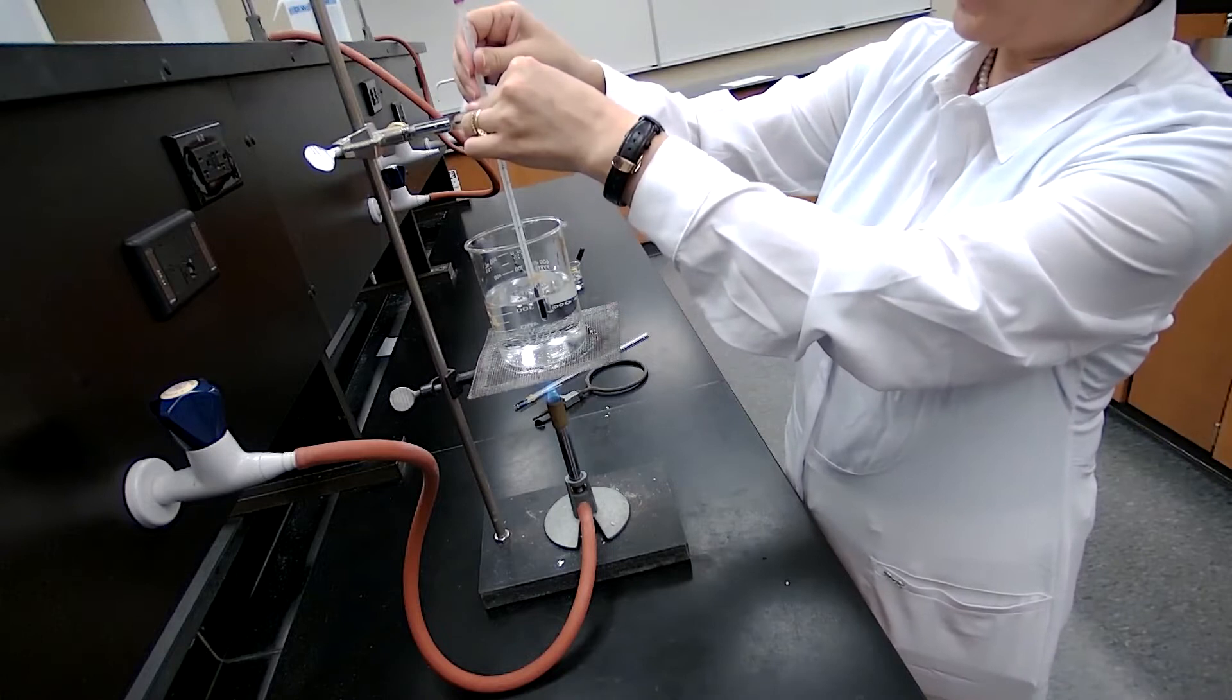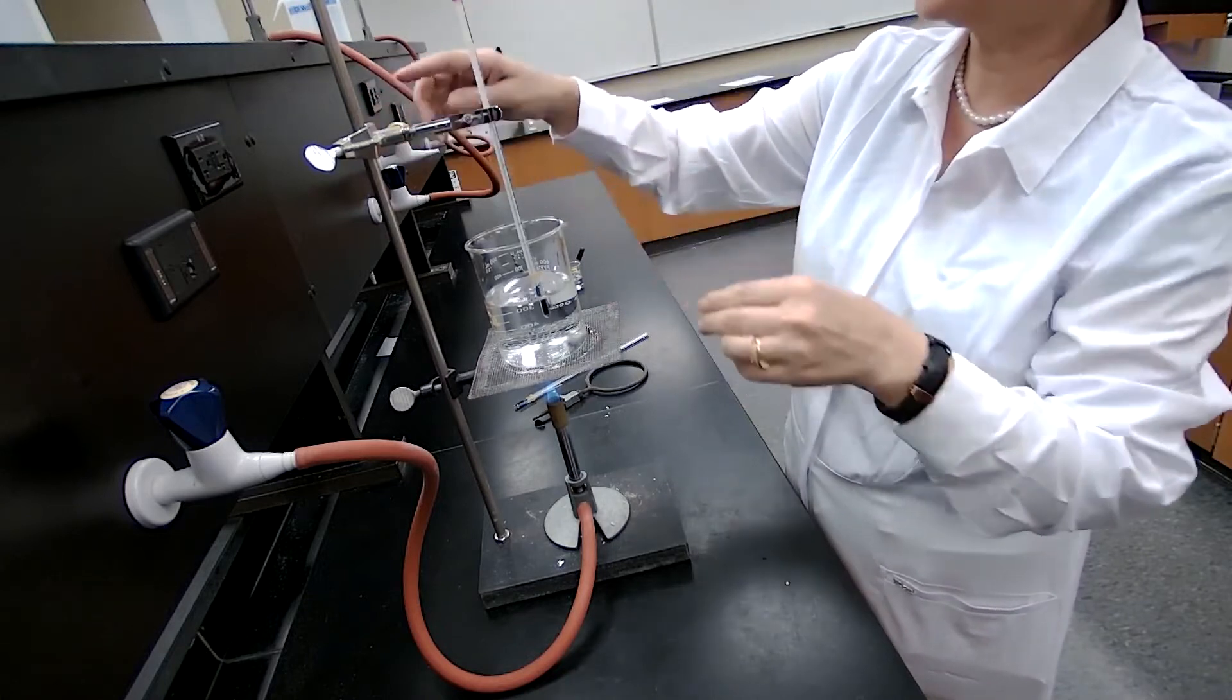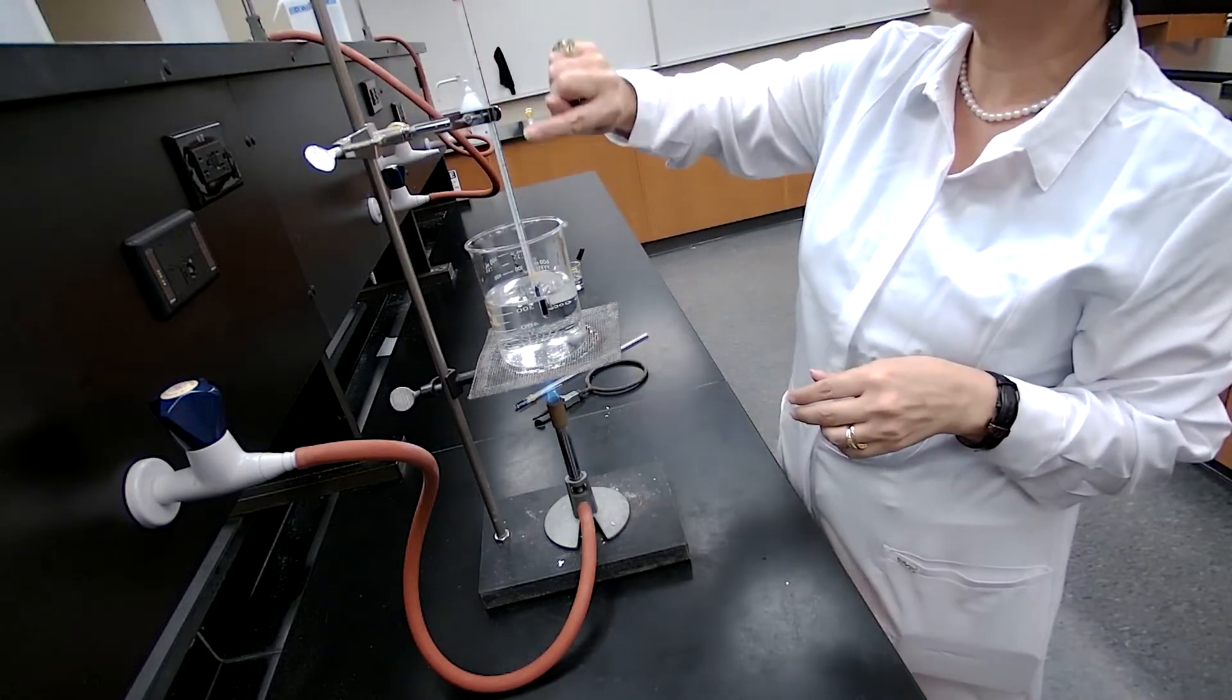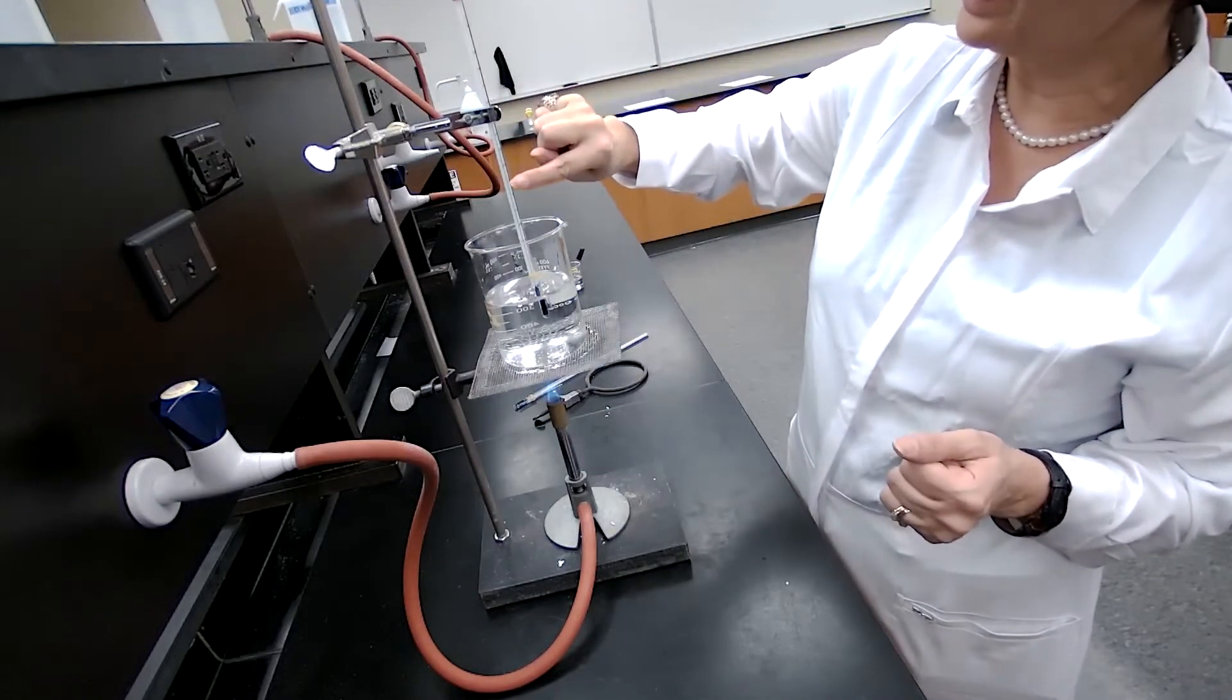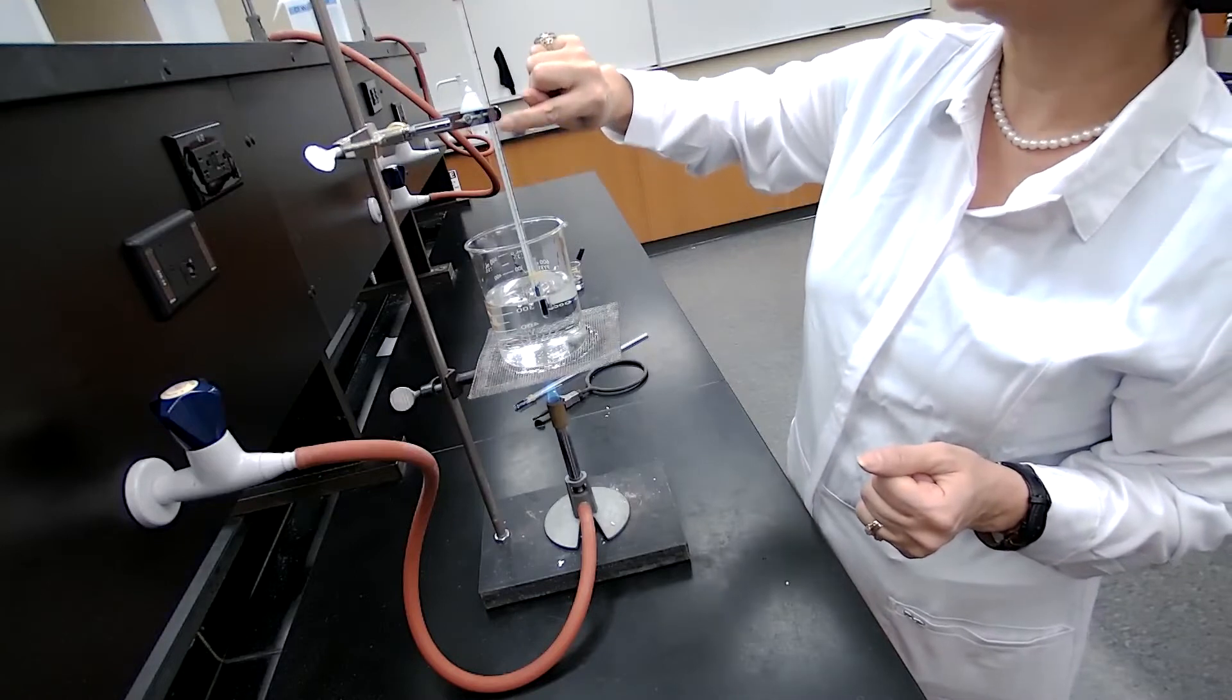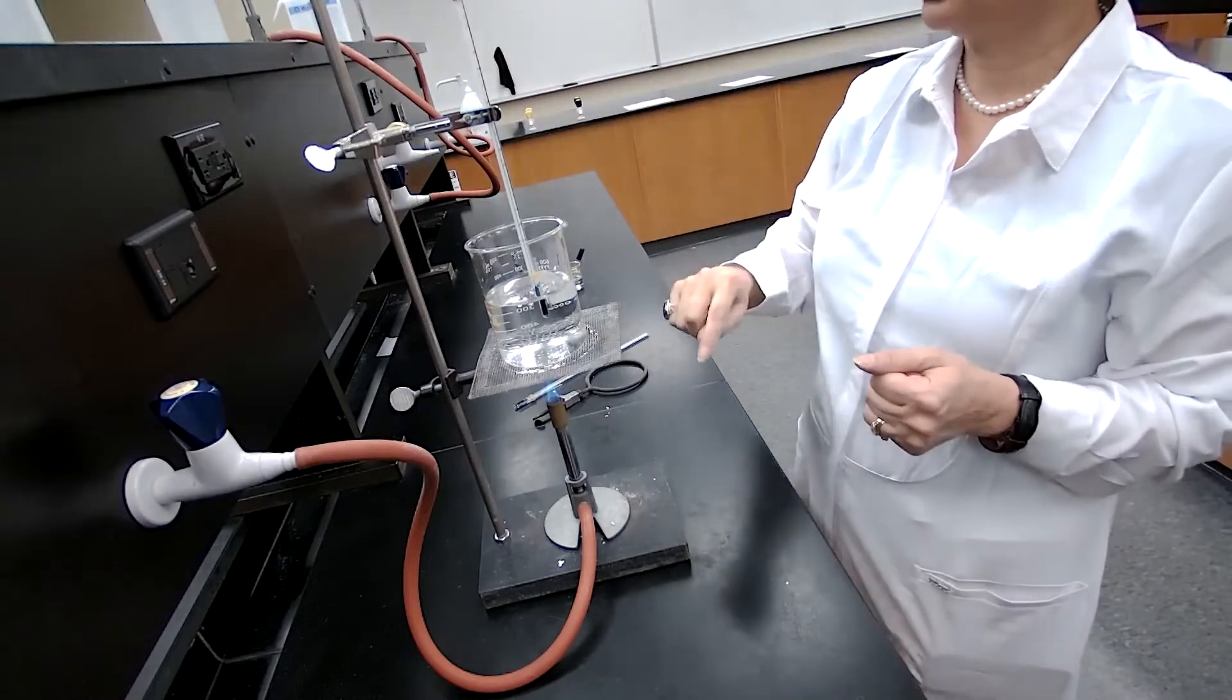So I like to make the adjustment to the height to make sure that I can see the colored alcohol that is going up in the thermometer.